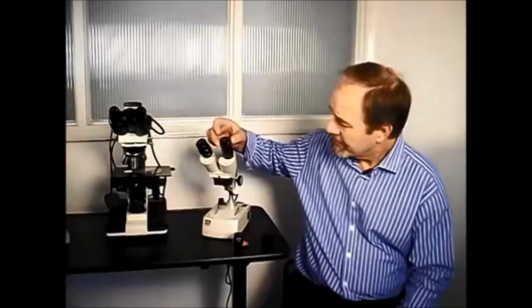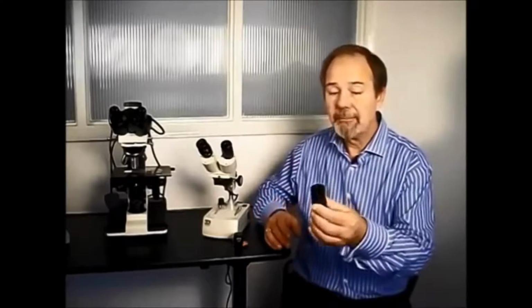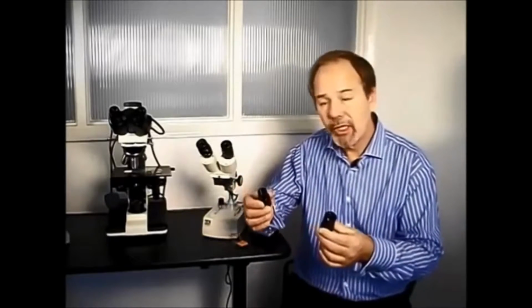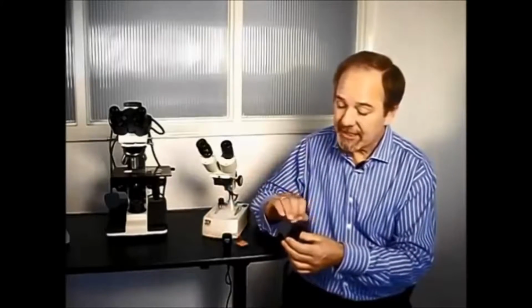Now, there are many brands of microscopes and types of microscope, most of which can be fitted with an eyepiece reticule. Now, the eyepiece of a microscope is fitted into a tube, and the tube sizes can vary from microscope to microscope, but predominantly there are two general sizes: the larger 32mm as used on this stereo, or the smaller 23mm used on many compound microscopes. Now, this diameter, this 32 or 23mm diameter, has nothing to do with the reticule diameter. The reticule is a simple disc of glass which is put inside the eyepiece tube.